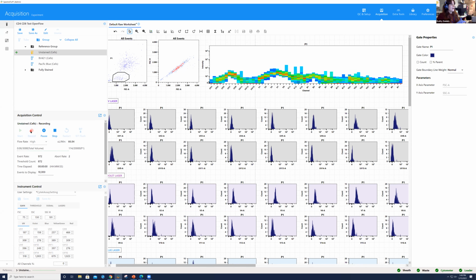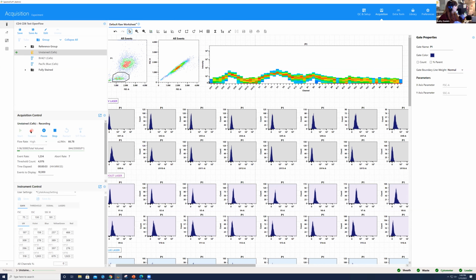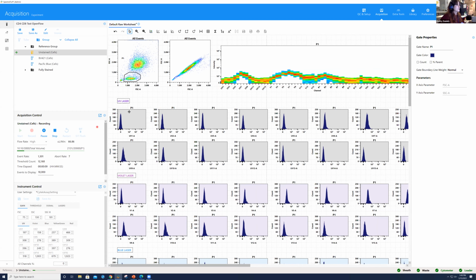Okay. I might not have 20,000. I'm going to do our best to see how many we have here. We do have a good number of cells though. And I did adjust my P1 to focus on these lymphocytes, which is my population of interest here for this experiment, seeing as how we're working with CD4 and CD8, okay? I do know that for the monocytes, we do expect some level of CD4 staining there, but our population of interest today is the lymphocytes.